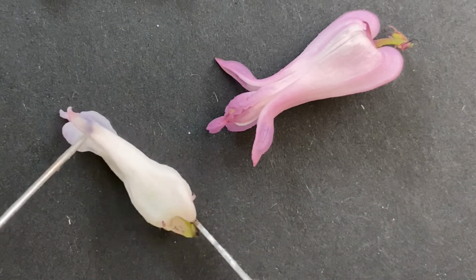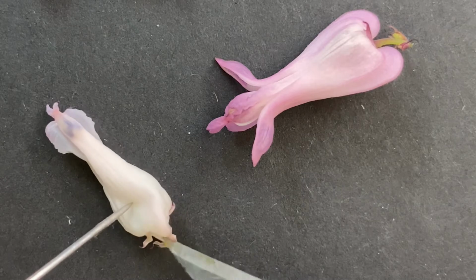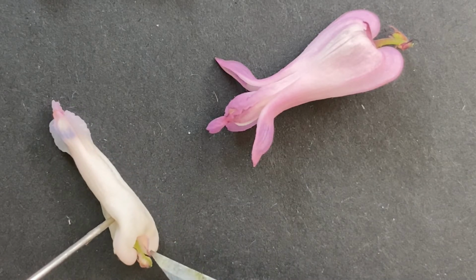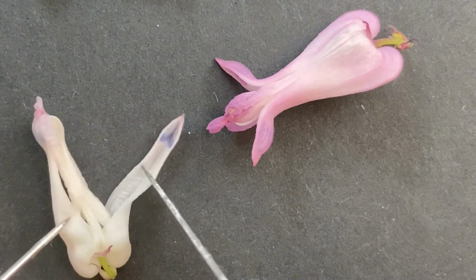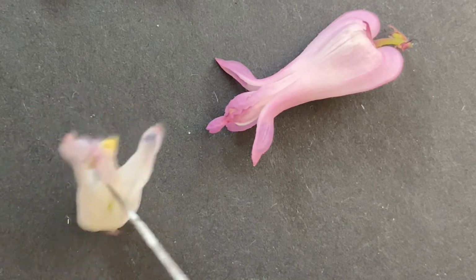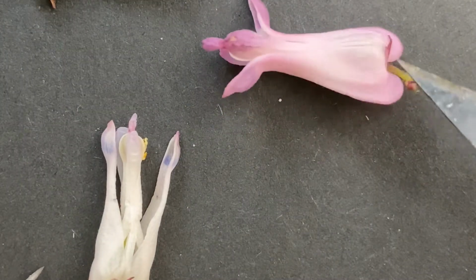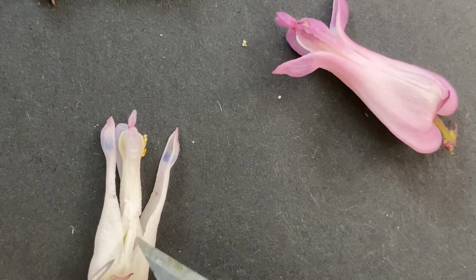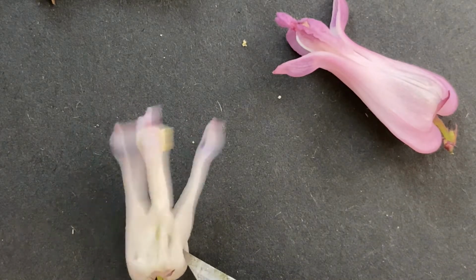So this one, you should be able to see the bract on the outside. Yep, there it is, right here. Very small, so it has 2, one on either side. And then let's see if we can pull off these. Move this guy a little bit. So I know that this one's pink and this one's white, and I really just think that there are some different colors on here. They're all a little different.